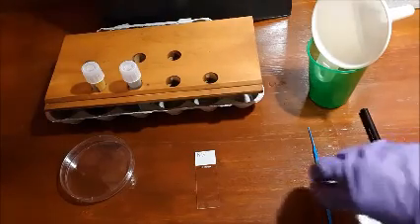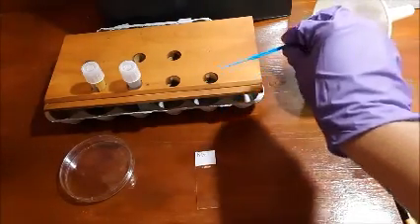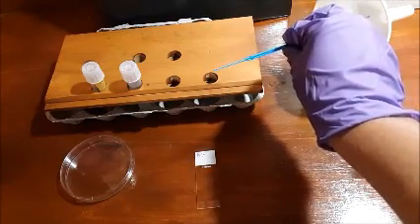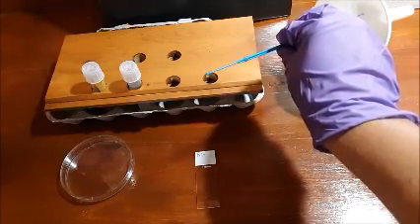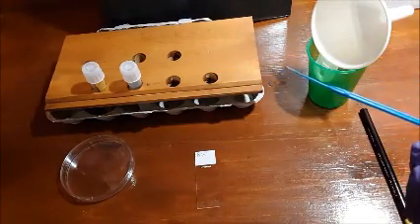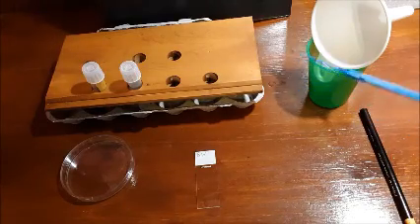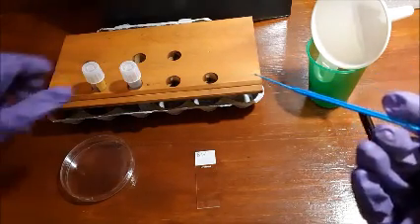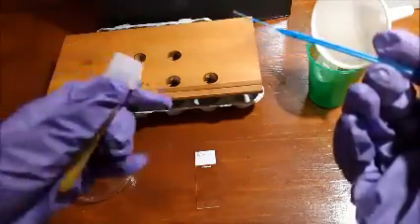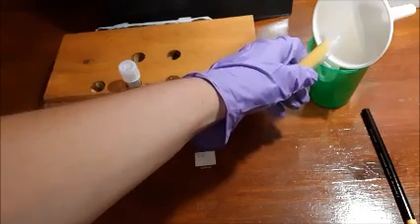To start, we are going to sterilize our inoculating loop by putting it in the Bacto incinerator for about 5 to 10 seconds. And then after we sterilize it, we're going to let it cool off. And just to speed up time, once the loop is cooled off, you're going to grab your slant culture, aseptically take the cap off, flame the tube for about 5 seconds.